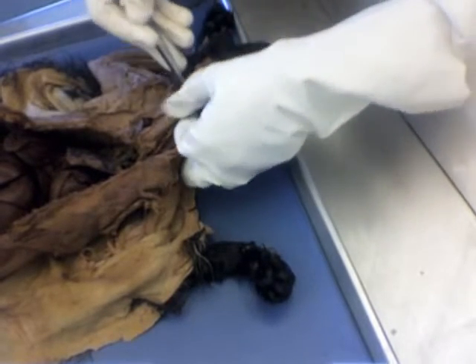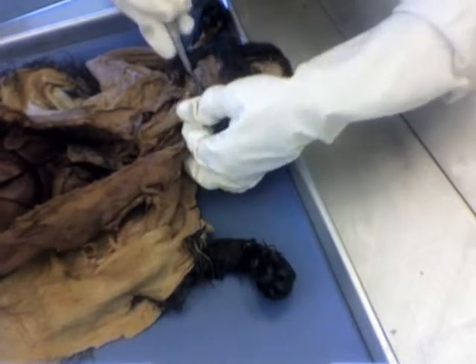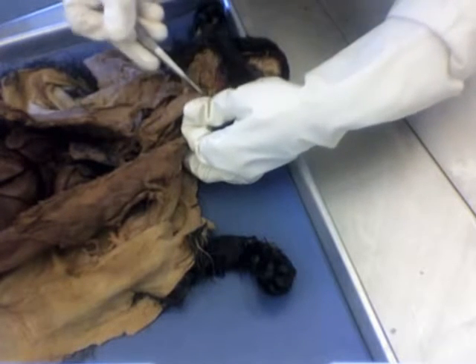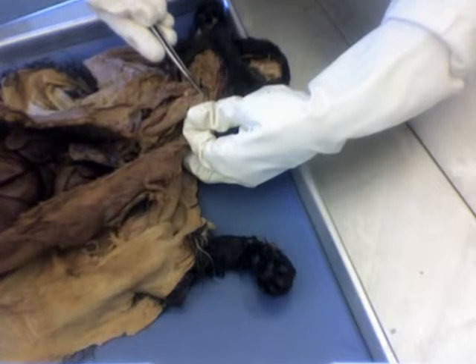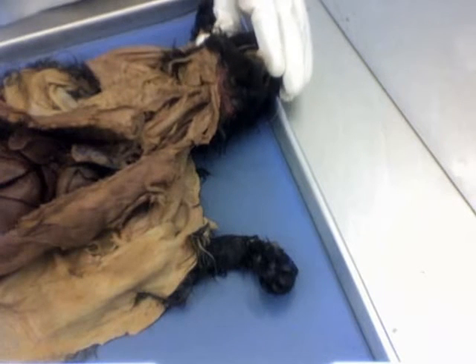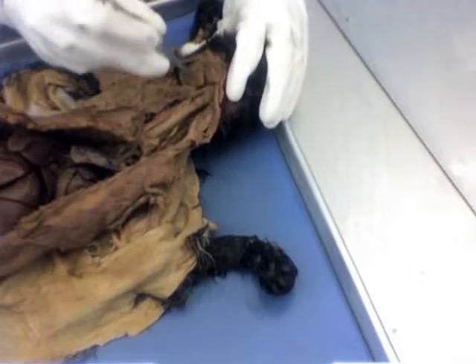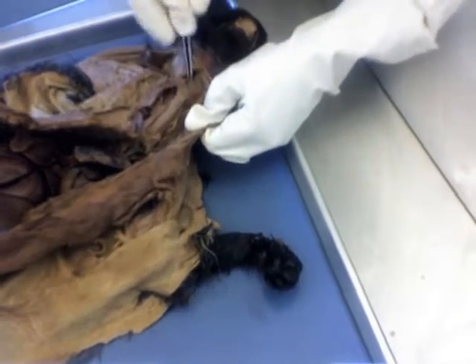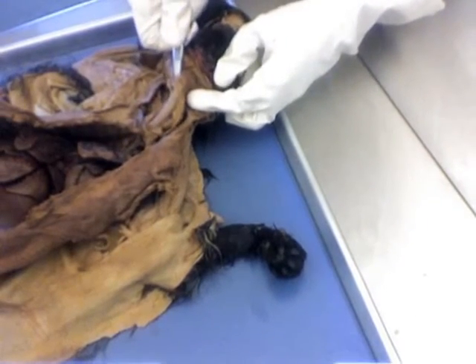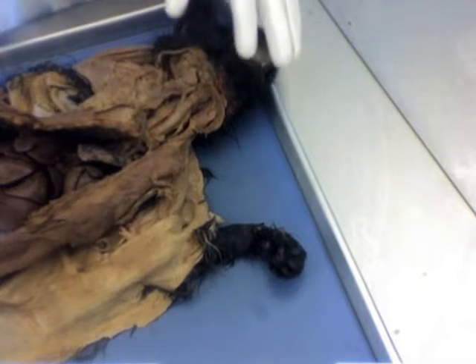again, I'm sorry, I know this will be impossible to see on the video, but there should be a little flap right there, which is the epiglottis. So the epiglottis is going to close over the glottis when you're eating, and thus food will be traveling down into your esophagus instead of entering down into your windpipe, which is ideal, so very functional.